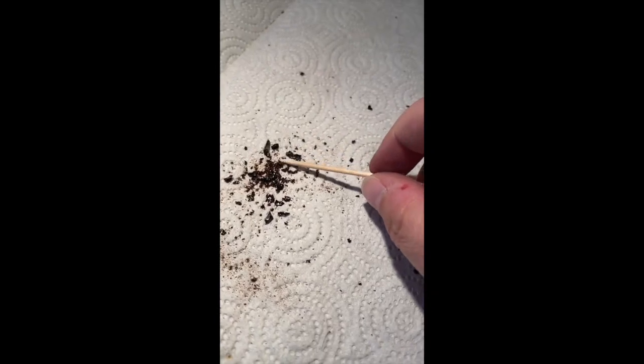All right, so I lied. One more tiny little snippet for you guys. I just wanted to show you that I picked off a lot of that brownish, blackish gloop that you saw bubbling and smoking on the foil. I picked it off and it has hardened. And I just wanted to show you what it looks like, just a little bit.